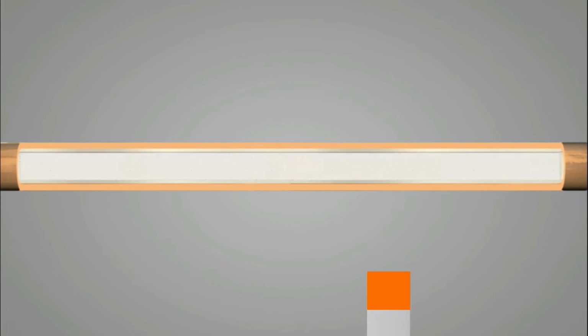So this is the flame ionization detector. There are so many other detectors used in gas chromatography, like ECD, electron capture detector, and then some other detectors. So this is the overall scenario of our gas chromatography, and the last portion is the detector.